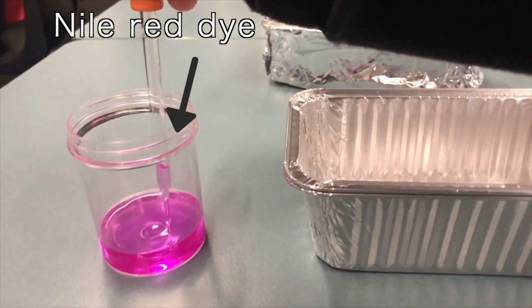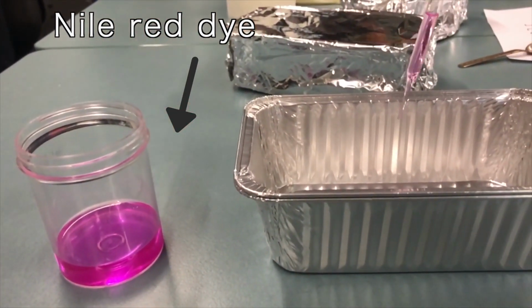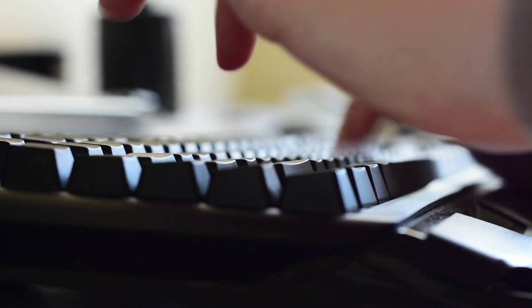We used Nile red dye to make the plastics in our sample glow under a UV light. Once the samples were dyed, we put them under a UV light under a microscope so we could see what we had found. After all that work in the field and in the lab, we were finally ready to do some statistics. But first, we had to figure out what questions it was we were trying to answer.